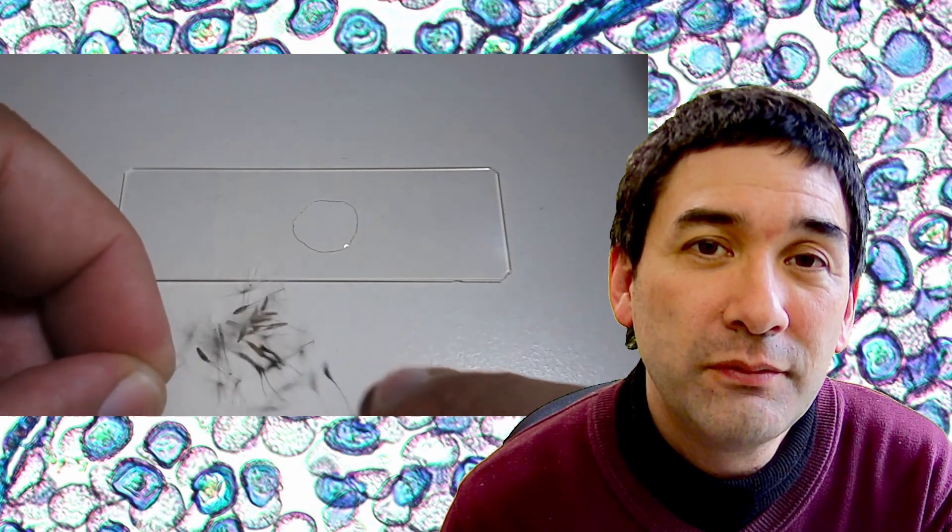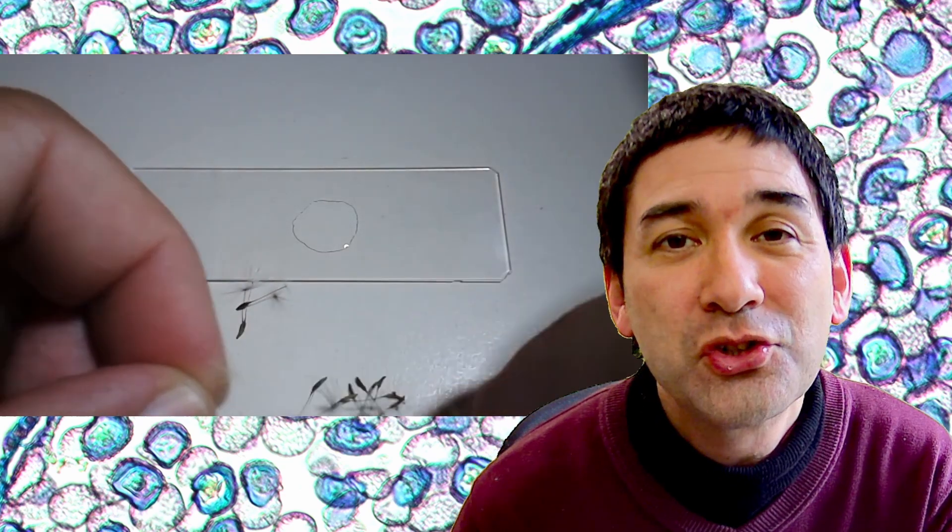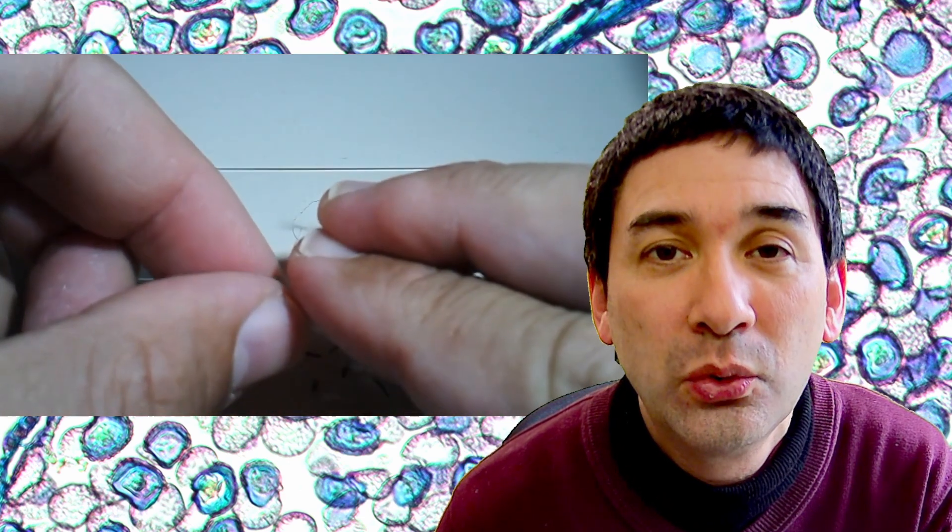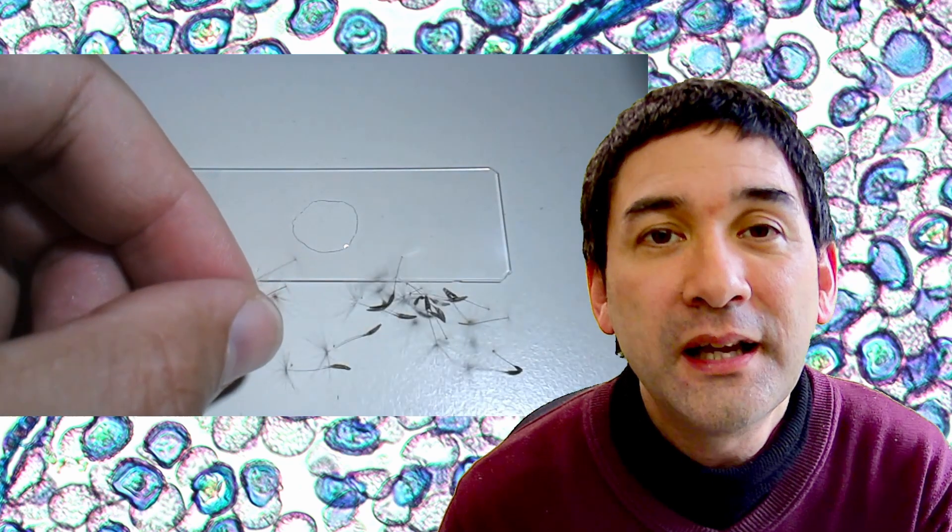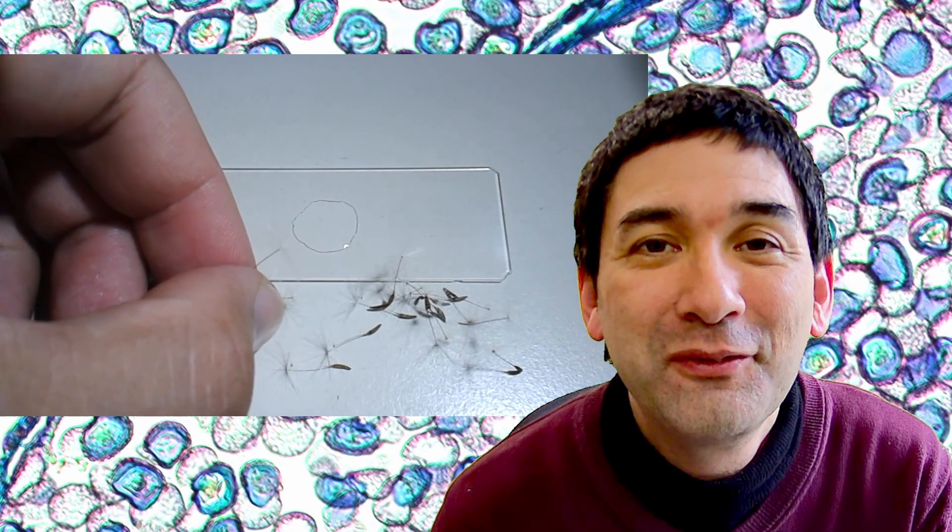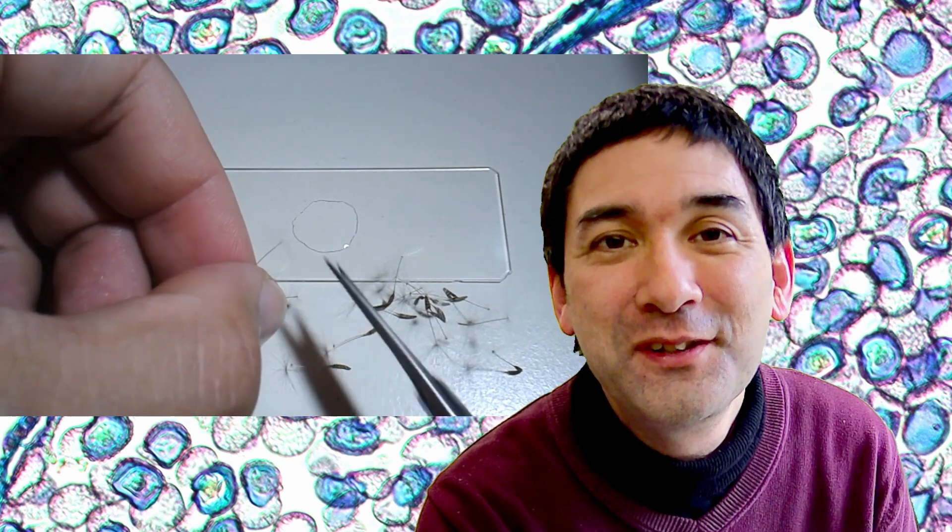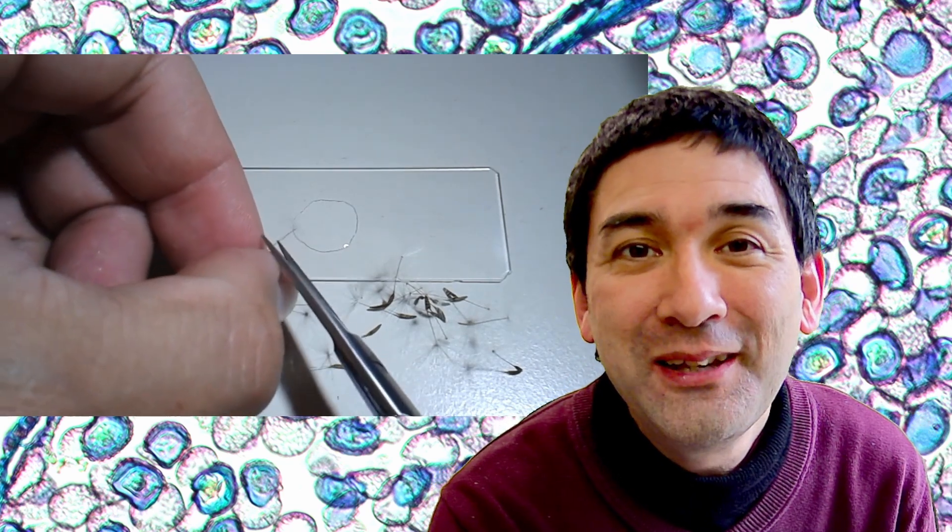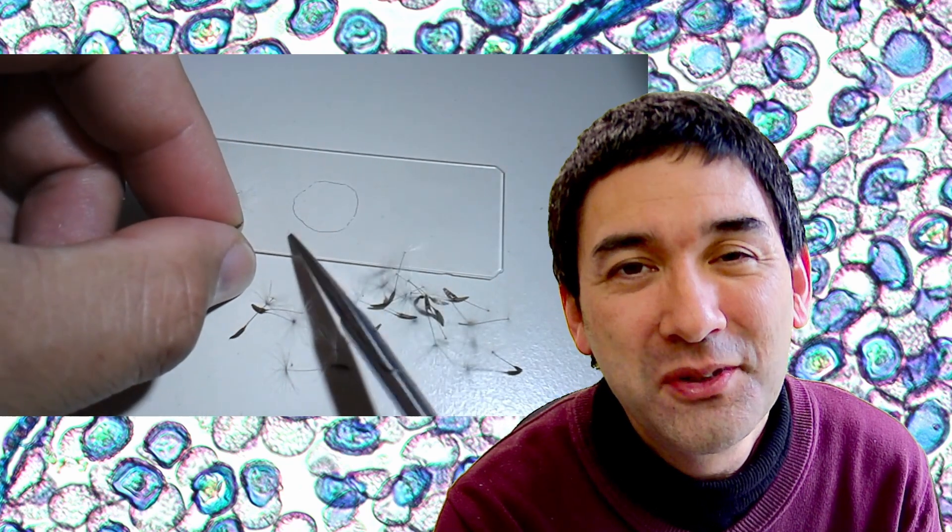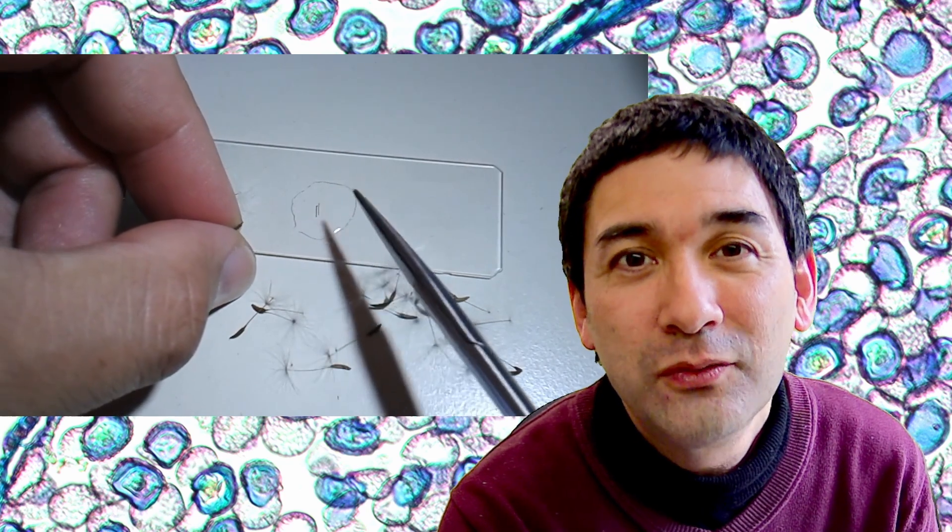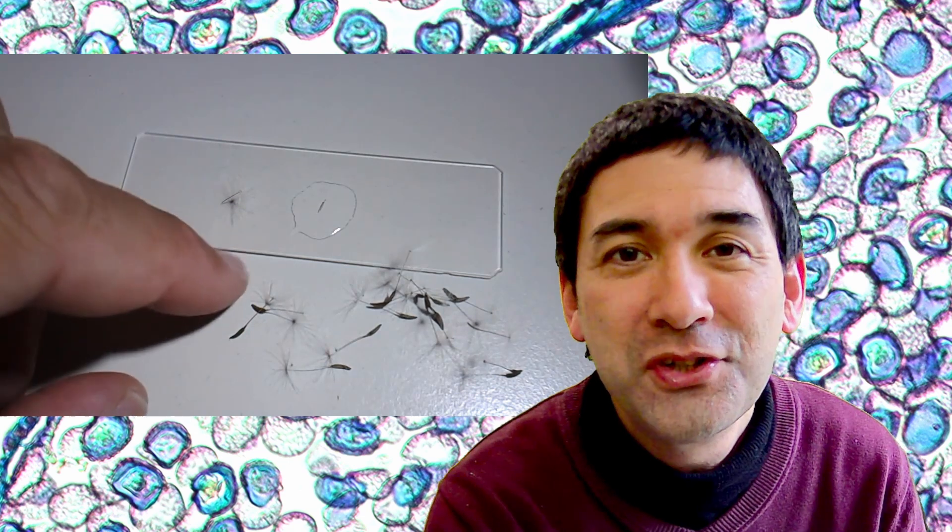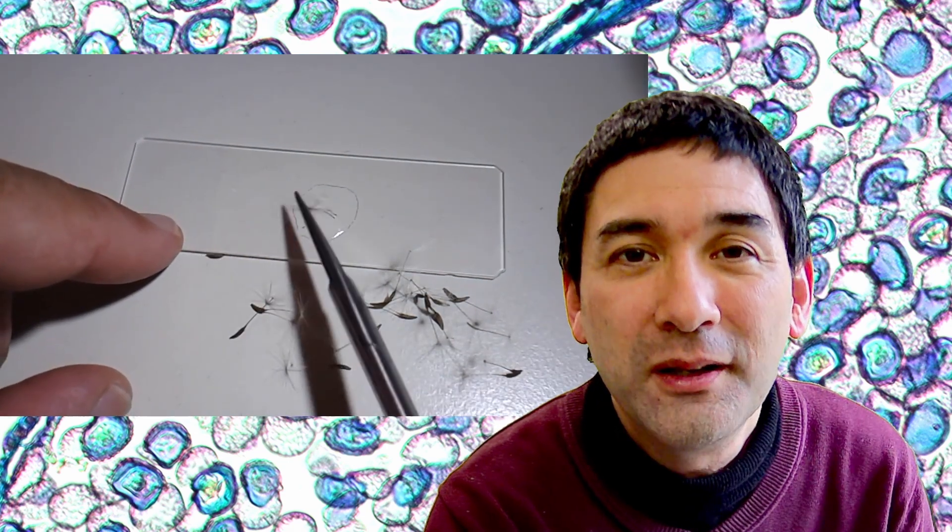Here are the seeds. I used scissors to carefully cut away the actual seeds so I could only use the shoot of the dandelion for microscopy. One of the big editing differences you can see is that I really took my time—sometimes even tedious to watch. Right now, I have a much faster editing style and cut away all the pauses so the video keeps moving.